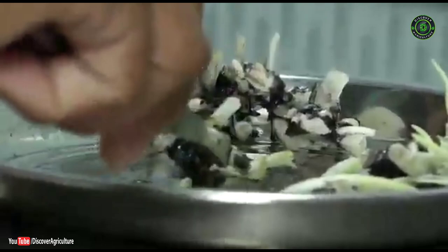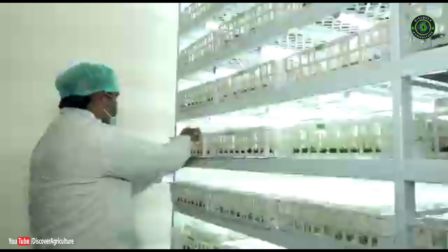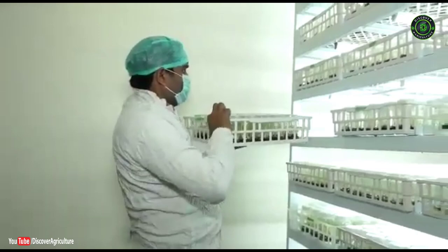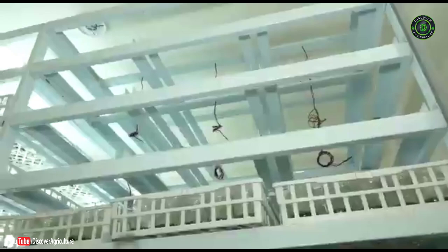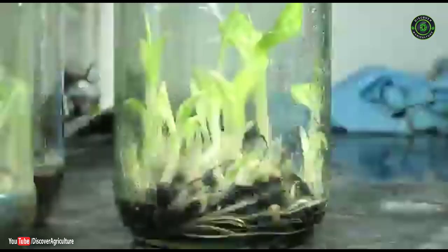The apical meristem is cut with 2 gentle cross incisions and the explant is transferred to subculture medium. During 20–25 days after the first subculture, the central meristem produces clusters of proliferating buds and 1–3 axillary buds are regenerated from the basal parts of the explant around the central apical meristem. This is repeated for 6–7 cycles, giving approximately 1000 shoots of banana which finally go for rooting as individual plantlets.